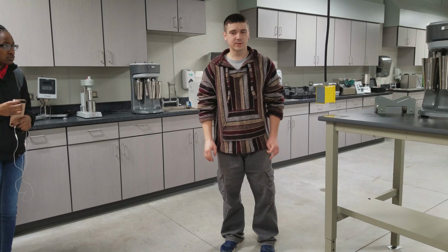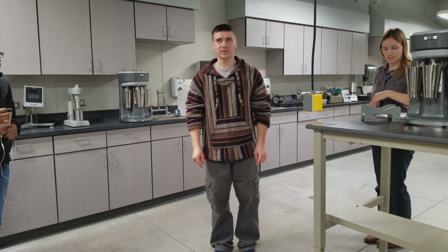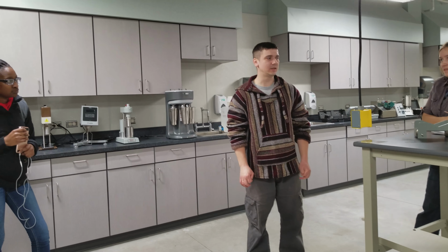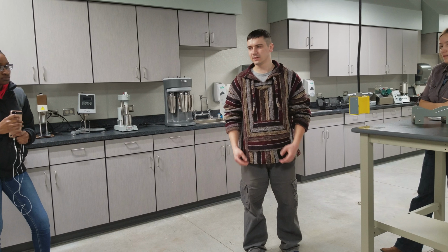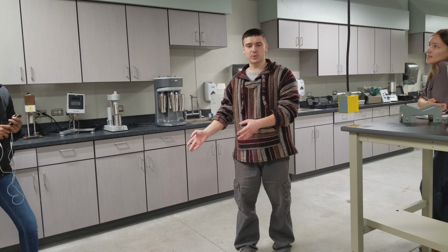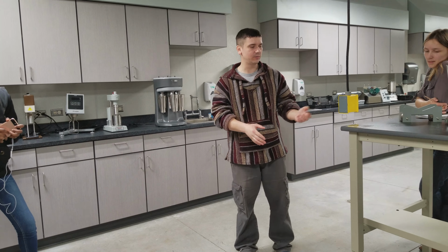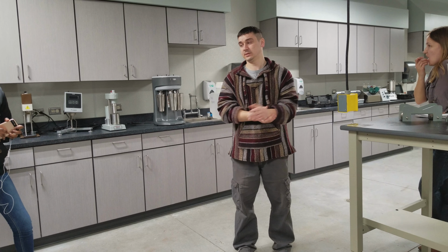The idea for you guys is to get familiar with the equipment. I'm not sure exactly what you're going to be doing for your assignments. That will come later, the specifics and details. But if I were you, I would take note of any keywords that I'll be using. A lot of them you've heard from the lectures that we're doing this semester. I will try to relate the experiments to specific relevant information from the course and to real-life applications, how it all finds applications in the petroleum industry. So I guess we can go ahead and get started.